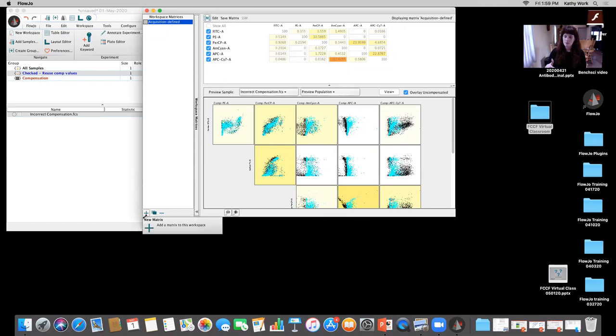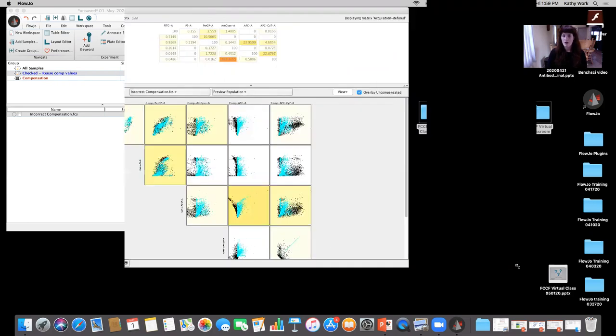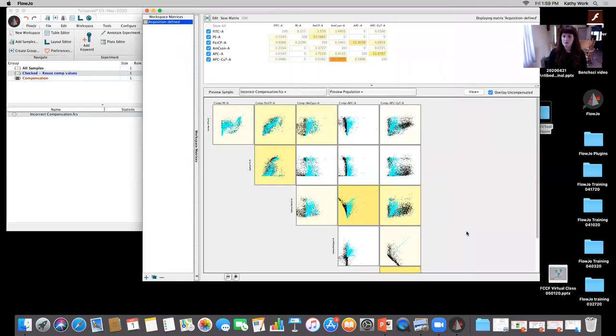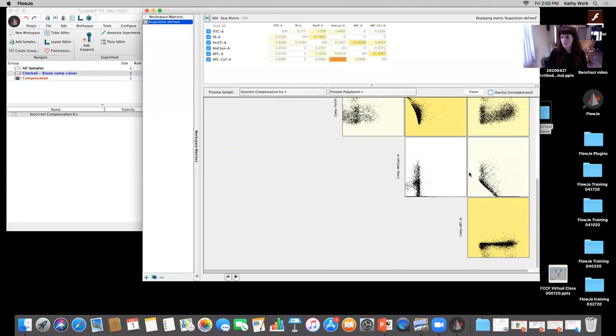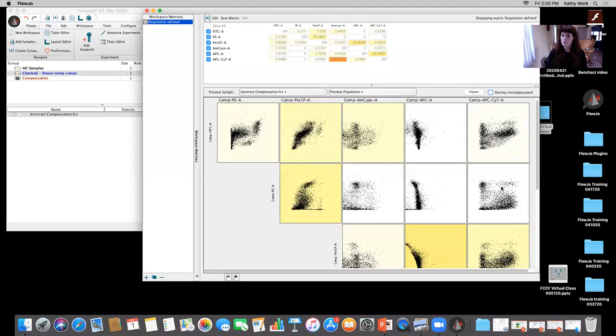So at times people might duplicate an experiment from their initial run or have a template of their experiment from their initial run with compensation values saved. And what'll happen is something like this, right? If I look at APC versus PerCP overcompensated, the teal is your original, and the black is your compensated. You also see here AmCyan and APC-Cy7. You have this pattern, if you follow my mouse, where everything is kind of completely going down, overcompensation, right? So these are all patterns that we're used to seeing.